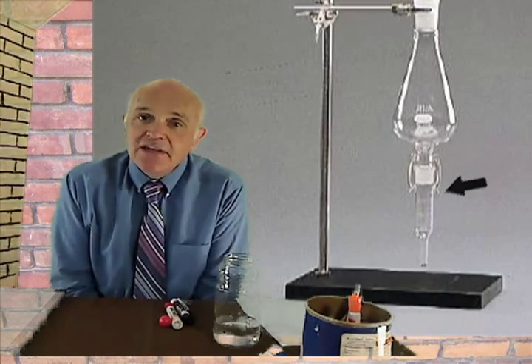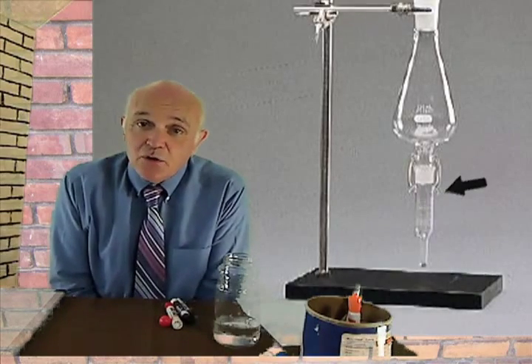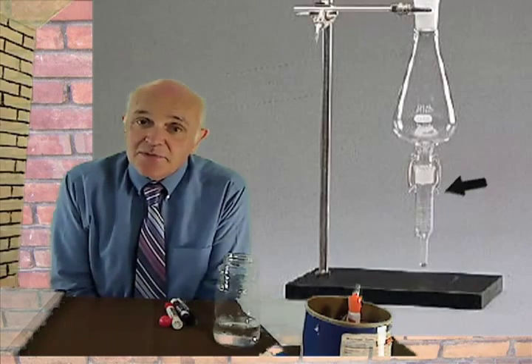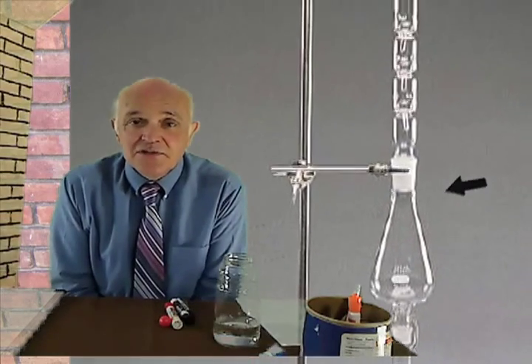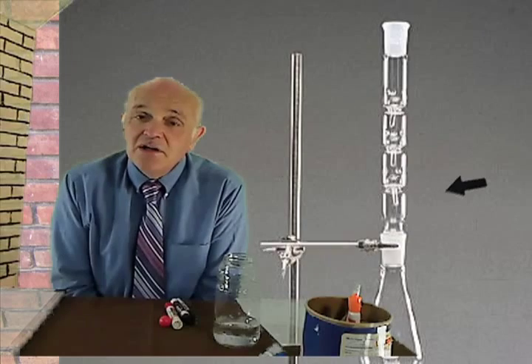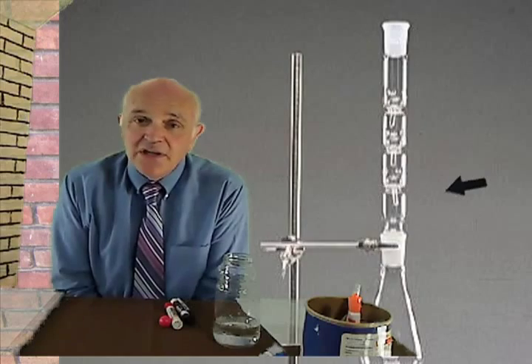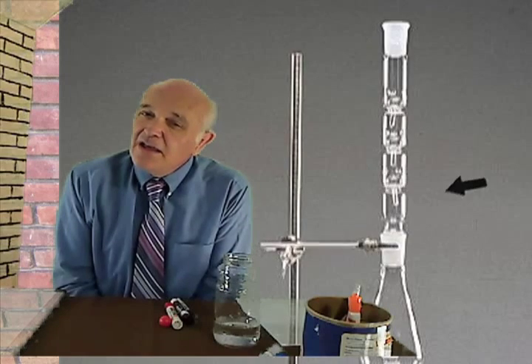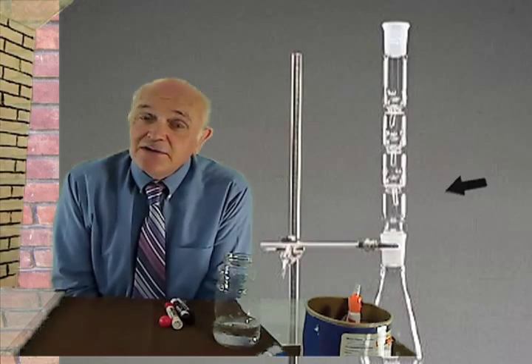The steam bath heats the methylene chloride up well above its boiling point, and the methylene chloride starts screaming out of the flask going into the Snyder column. When it reaches the Snyder column, it's relatively cool. You know, it's like maybe, I don't know, 50 degrees centigrade or something like that. It's a little bit cool. The methylene chloride fights its way through these little balls. The Snyder column kind of filters only the methylene chloride, and things that are very volatile are able to fight their way through the column and get out and completely escape.